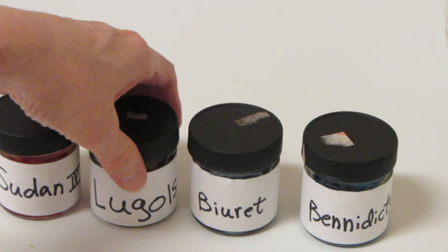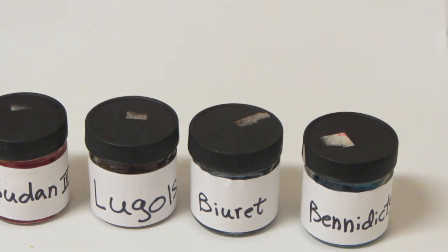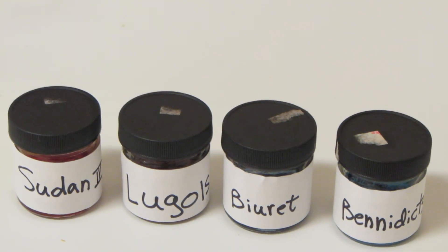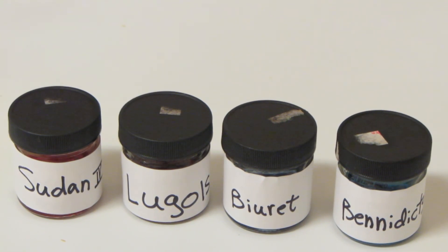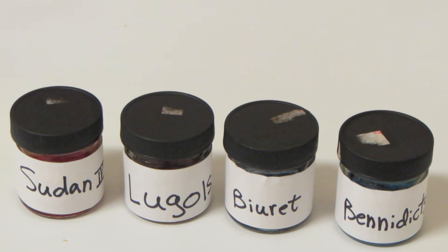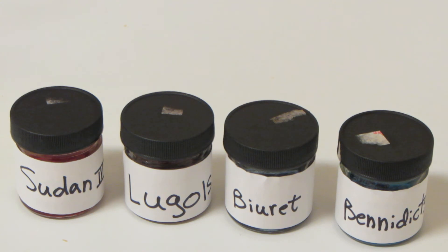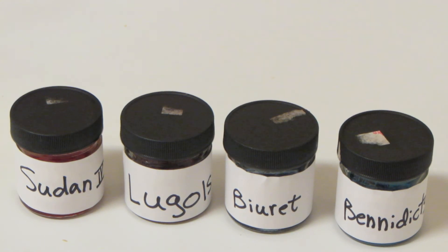There we have our four solutions that are typically used to identify our food molecules. We're going to take you through a series of videos that will identify each one at a time. But that's it for this one.